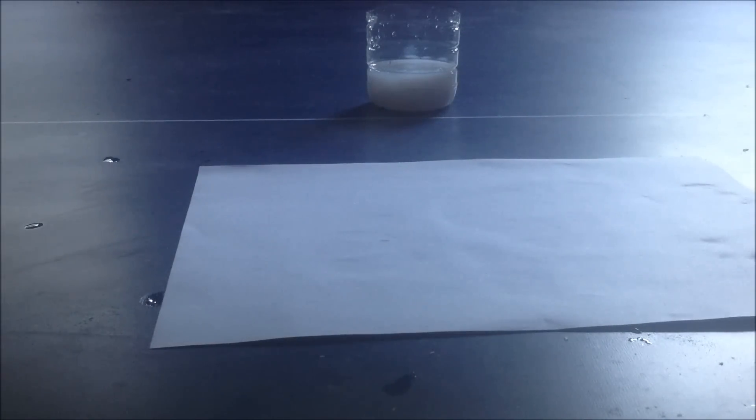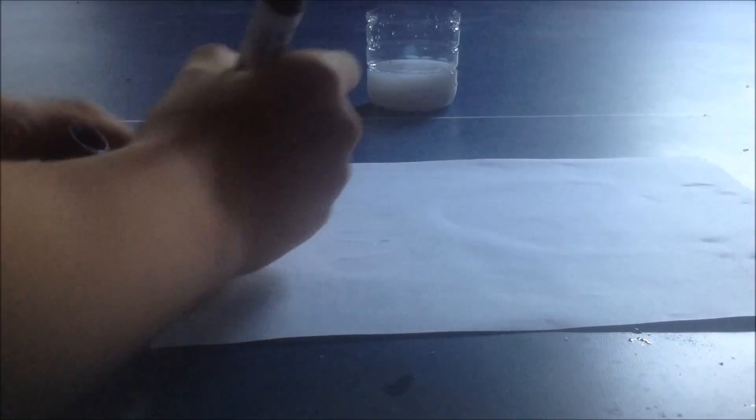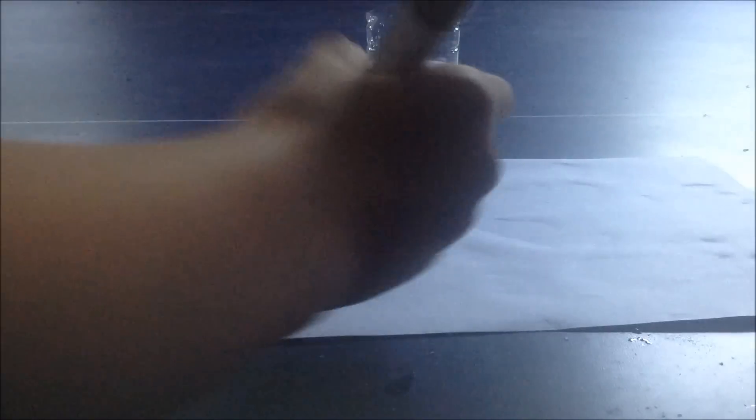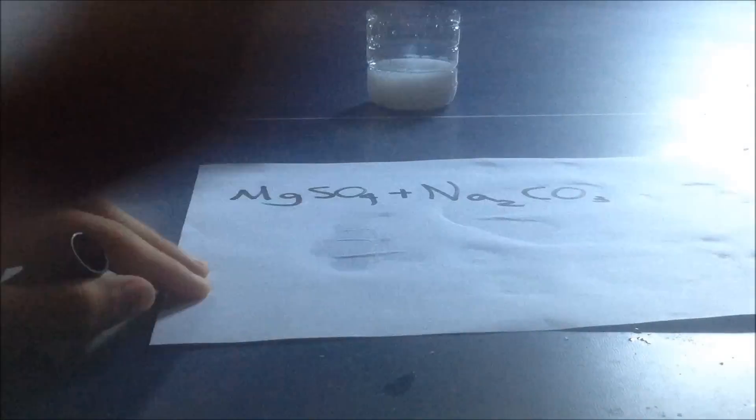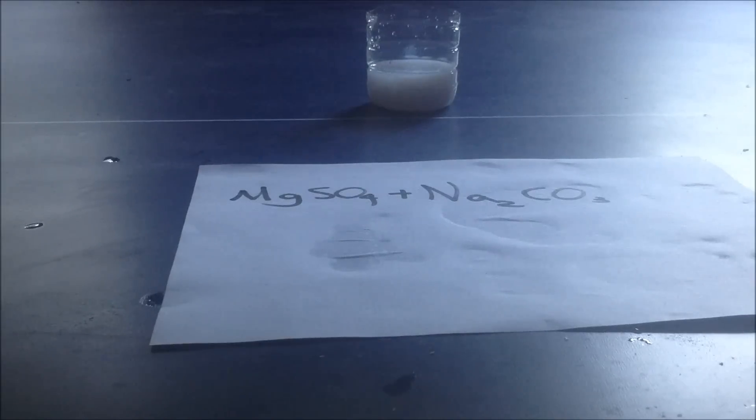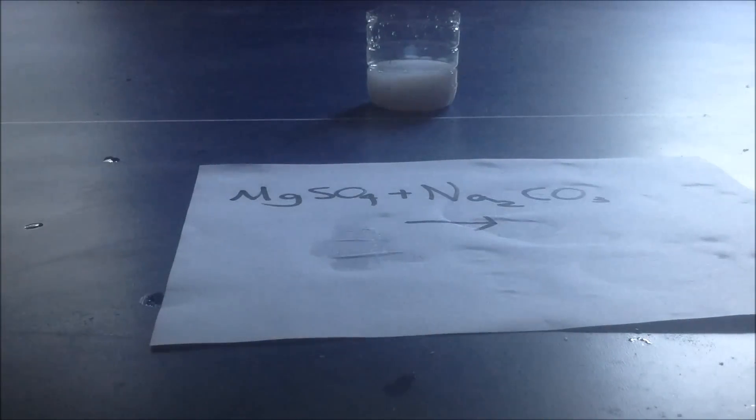So the reactants are magnesium sulfate and sodium carbonate. You see that? Okay.